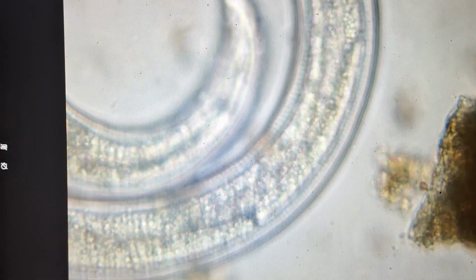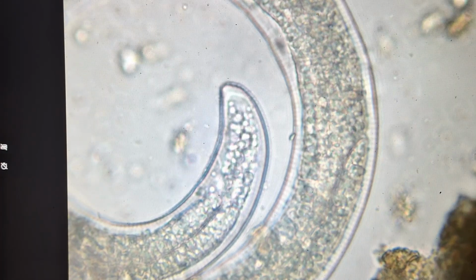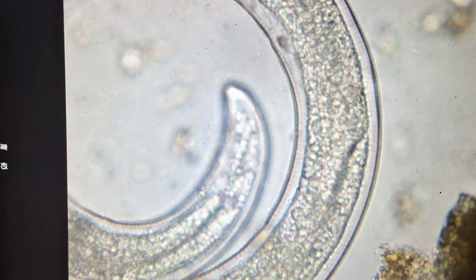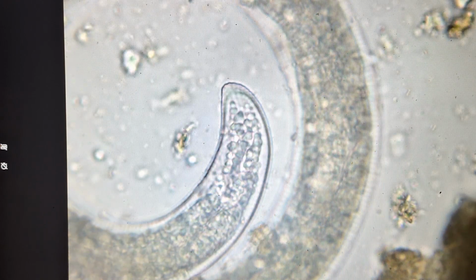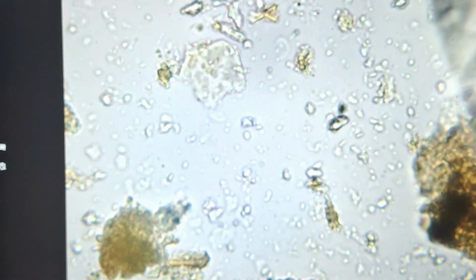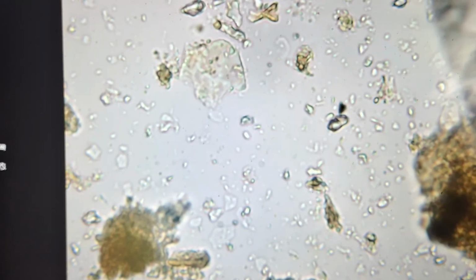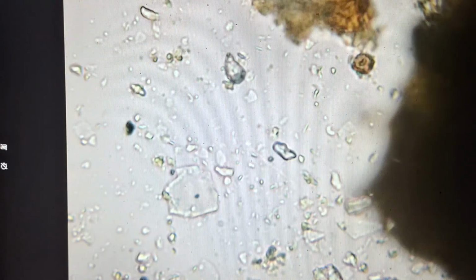You can also tell a male and female by their tail. And I believe this is the female. The male would have a longer, pointier tail on it. I think what I'll do is I'll pause here, and I'm going to have a look for other members of that food chain, that food web. So we're seeing the bacteria all over. Now let's see if we can see some fungi and some protozoa.